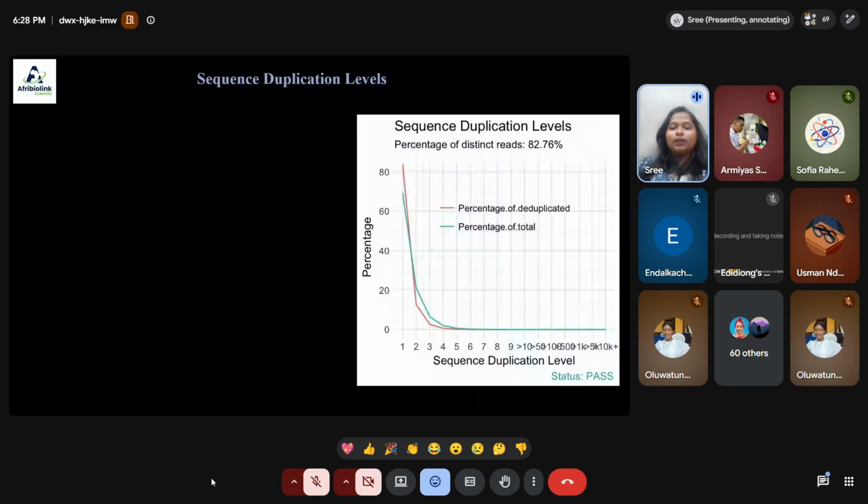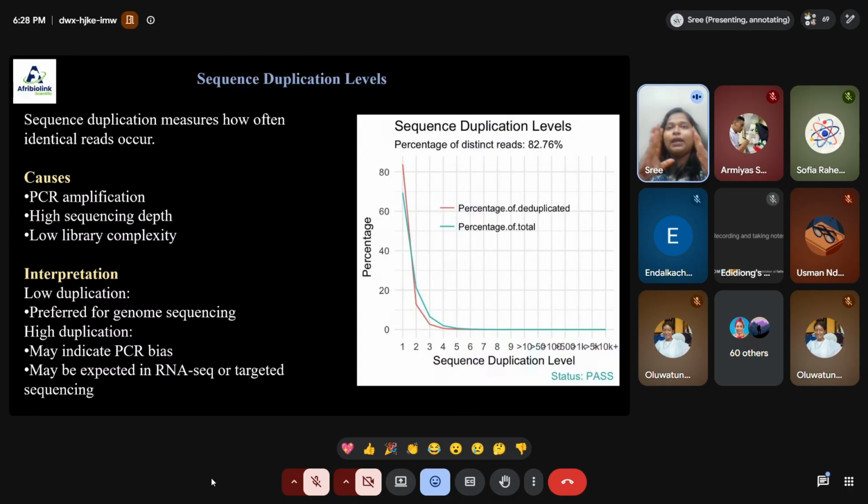Next thing is called the sequence duplication graph, which just tells you how often identical reads occur. Sequence duplication occurs in the sequences maybe because of PCR amplification methodology, or because of high sequencing depth, or due to low library complexity. In all those conditions, sequence duplication might happen. If the duplication is lower, it is preferred for genomic analysis. If the duplication is higher, it may be due to PCR biases or any type of expected error that happened during that time.